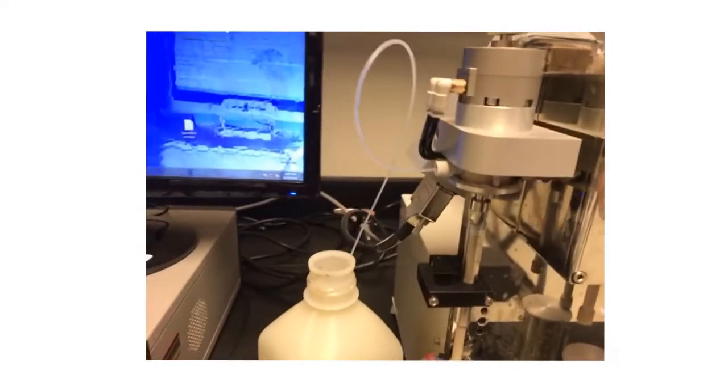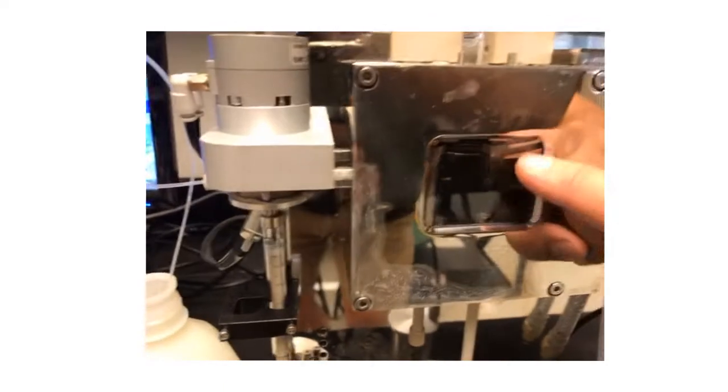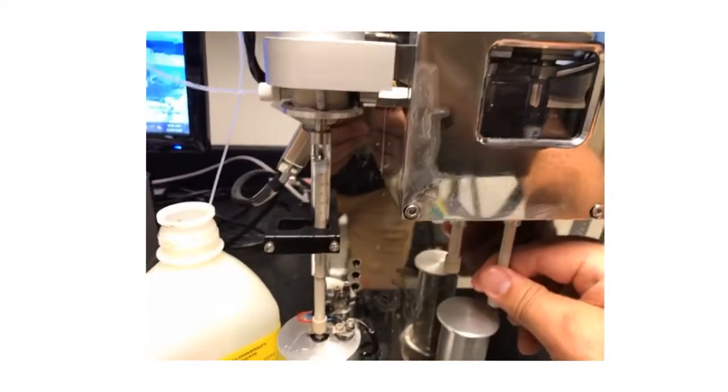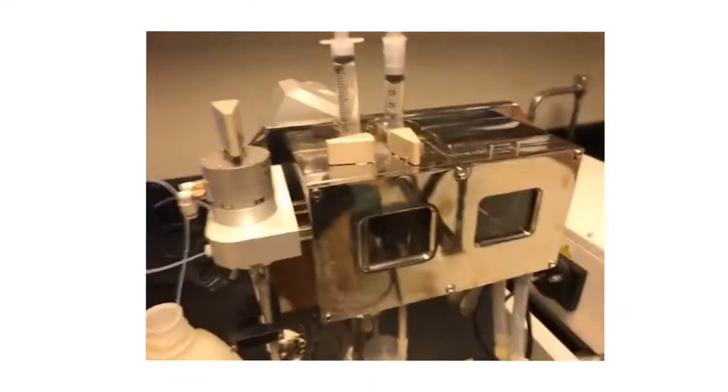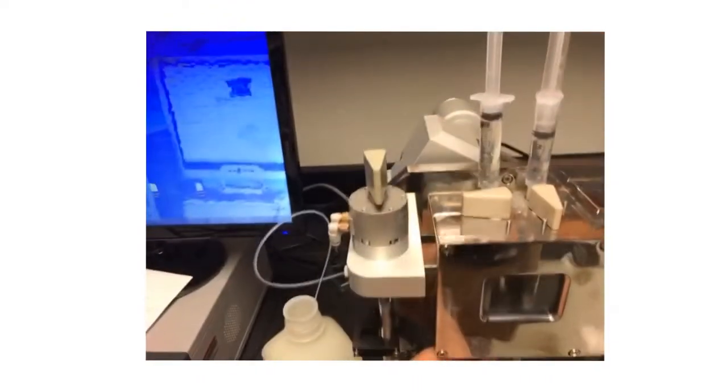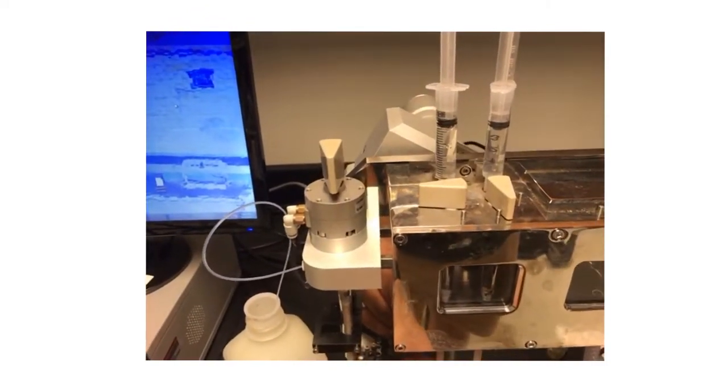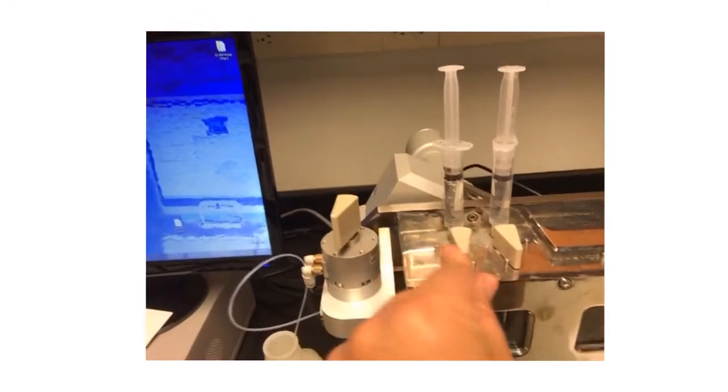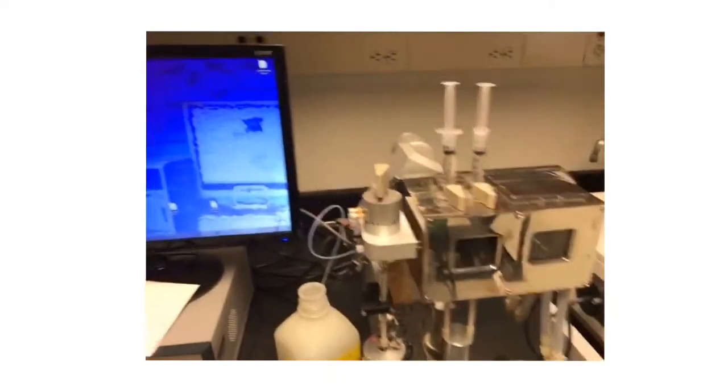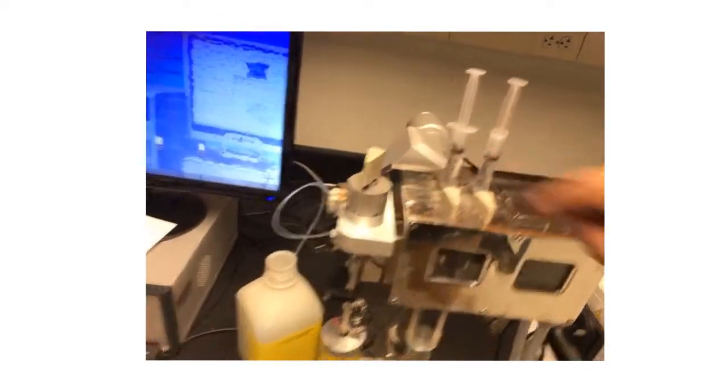And you're trying to make sure you don't get air bubbles. If you can see into the syringe here, you might look for air bubbles as you're adding the new reagent. And then lock into place. Likewise, we can swap the other reactant out as well. Add the new one in. Of course, we're just adding water here. But that is sort of mimicking reactant A, reactant B.